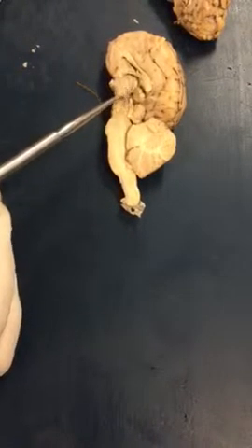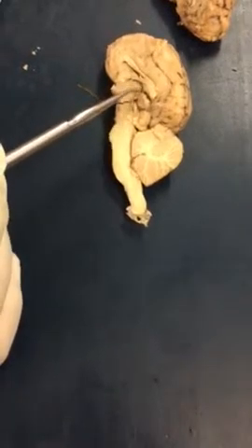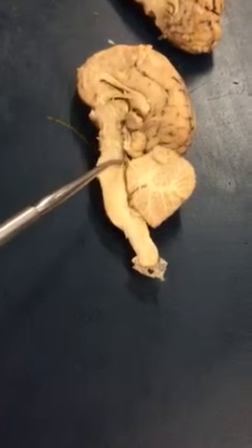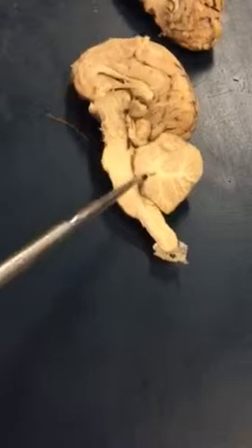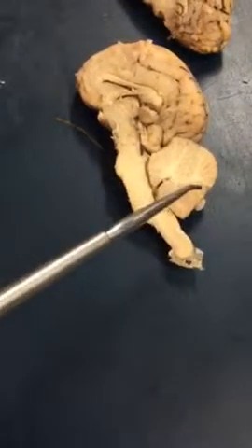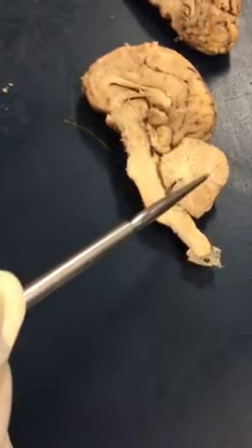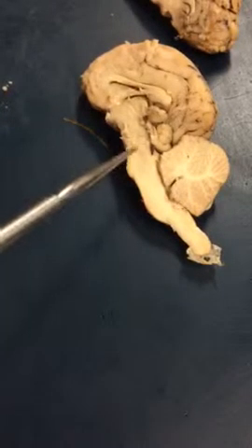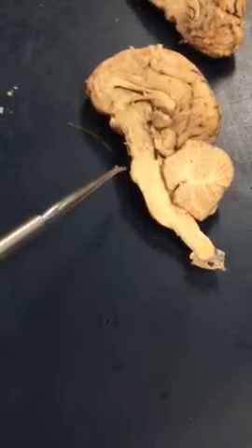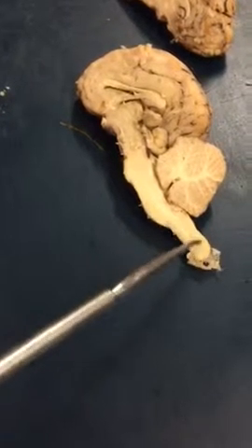Here is the cerebral aqueduct. So if you follow the third ventricle down, it's going to go through that cerebral aqueduct as far as the cerebrospinal fluid, come down, and then eventually drain into this fourth ventricle. And from the fourth ventricle, it goes out and surrounds the brain. Here's the cerebellum. In the cerebellum, you can see the deep white matter, which is the arbor vitae. If we come back to the brainstem, this is the midbrain region. Here's the pons, where you see this bump. And here's the medulla, where you see this bump, and then this would be your spinal cord.